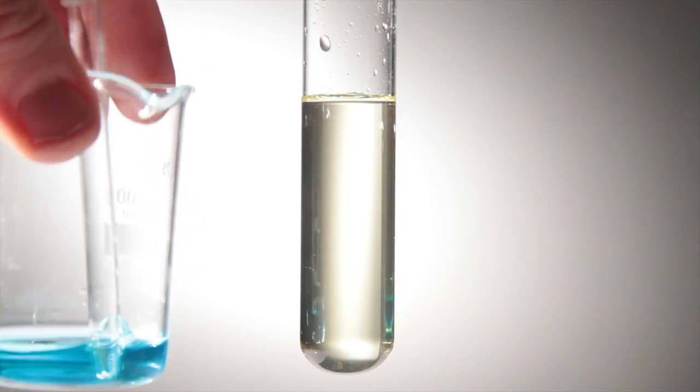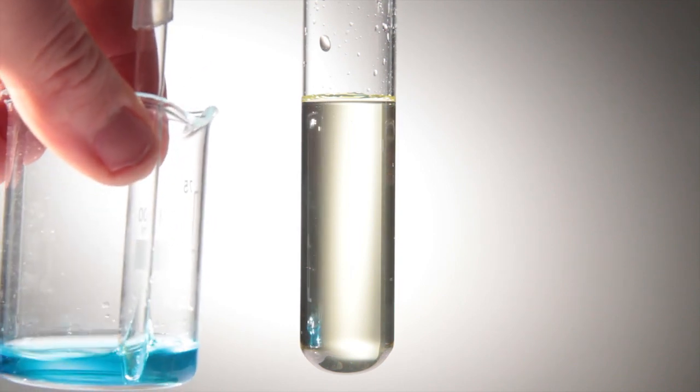If you messed up, you can always add a few drops of water to the copper sulfate solution to try and rescue it. Now you've accurately made these solutions, you want to avoid any cross-contamination.